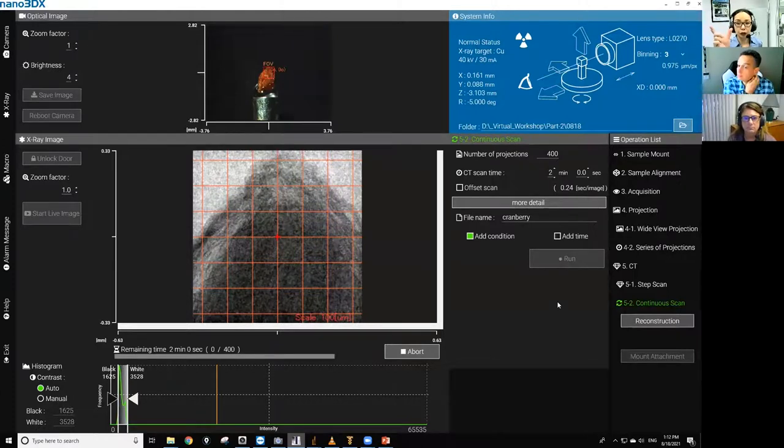When you do stitching, you want to do the stitching in a vertical way. For the width, you can do what we call offset scan, meaning that there is a way to maximize the detector size, meaning that you look at half of the sample first. Then when the sample rotates in the other way, you look at the other half of the sample. By doing so, this is a complicated one to explain by talking about it, but you can double the detector size effectively to cover the entire width of the seed. Then with that offset scan, you do probably top, middle, and bottom, or top and bottom halves, and merge the resulting scans afterwards to have the entire seed scan.